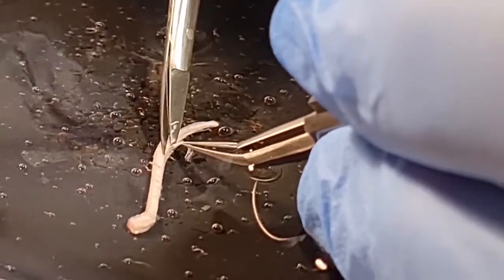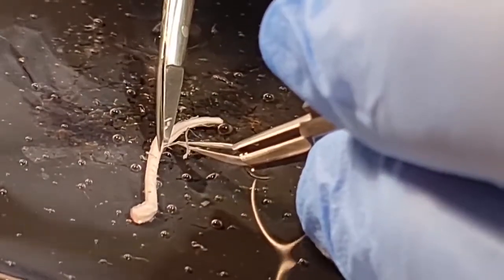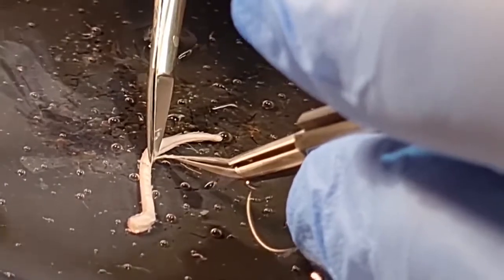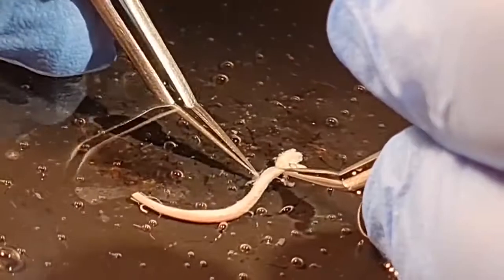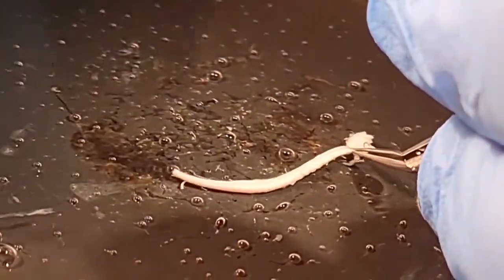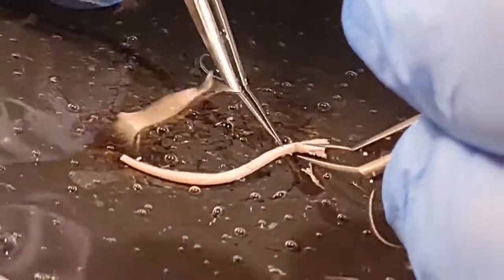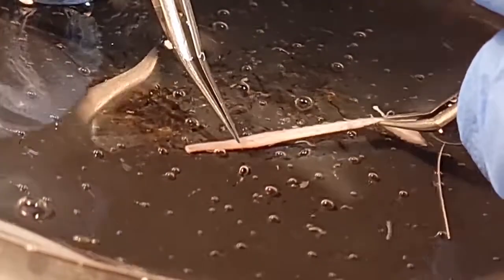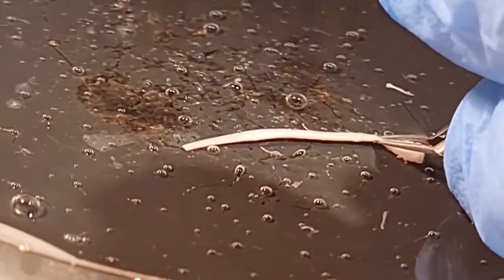After you're done with the cleaning of the roots, the next step will be to remove the meninges. For removing the meninges, one holds the pia mater with a fine forceps and then peels it off very gently and carefully from the surface of the cord.